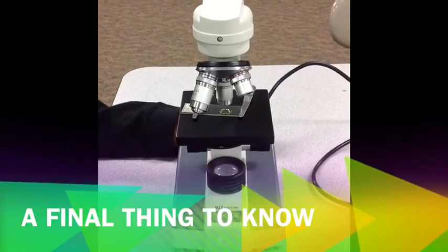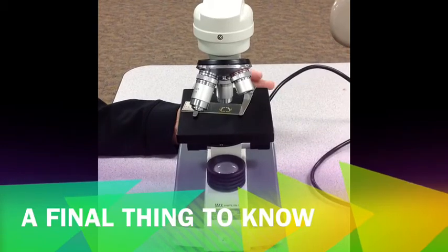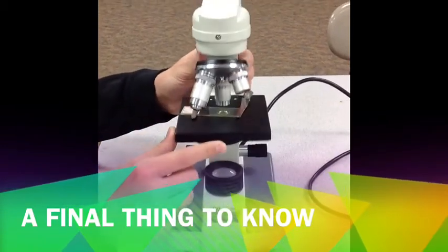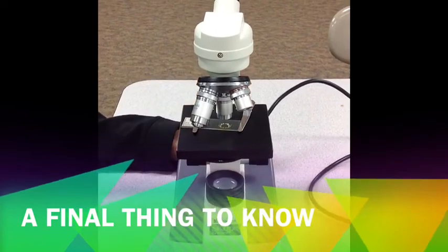After you've done all these steps and your picture still isn't clear, you can always adjust the diaphragm which is located right here and you can let more or less light into the microscope.